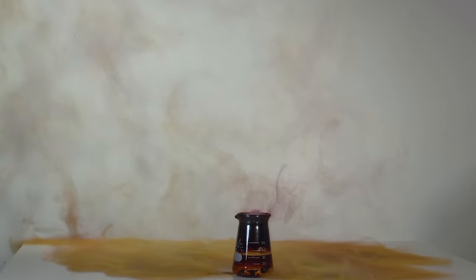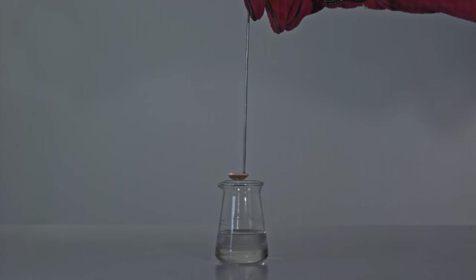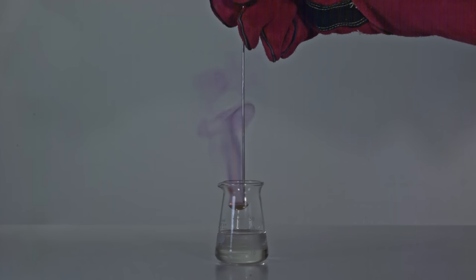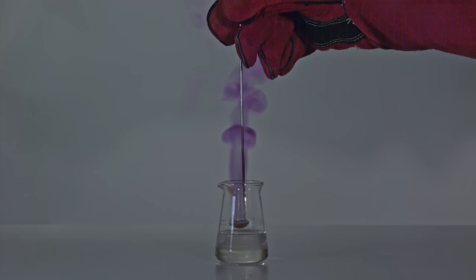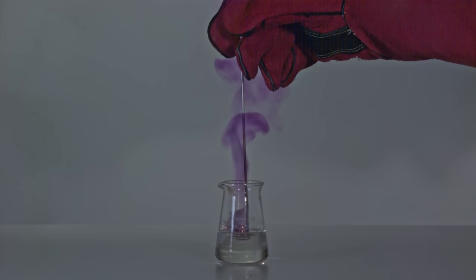Methyl iodide is a quite volatile liquid. Judging by the formation of purple vapors of iodine, we can see this moments before the contact between the liquid and burning magnesium occurs.